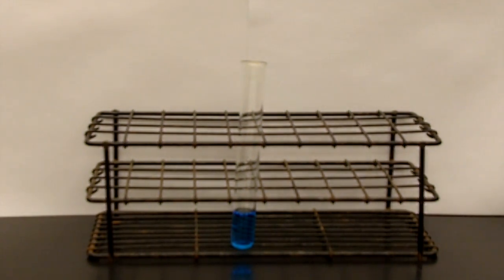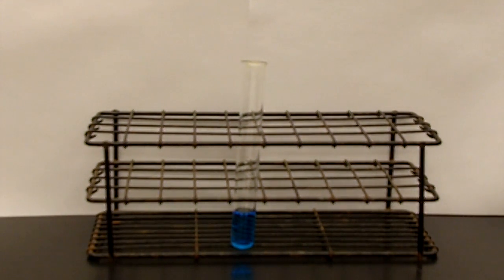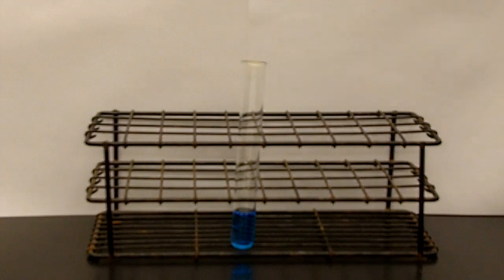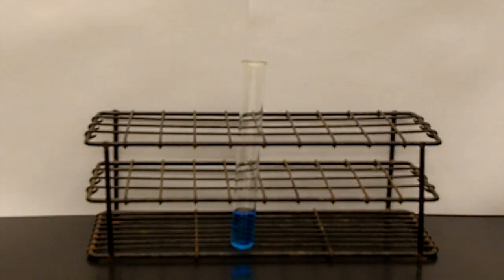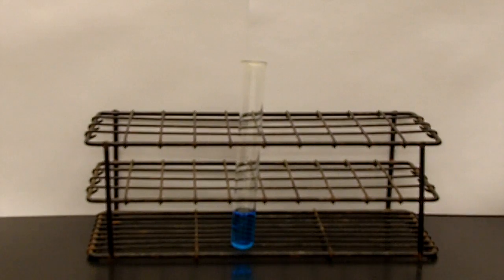Hello, general chemistry students. Today we're going to be running some precipitation reactions, and you're going to balance the equations and tell us what happened.